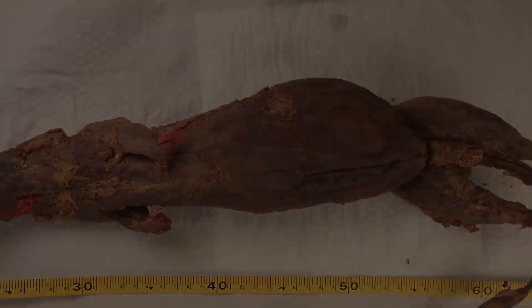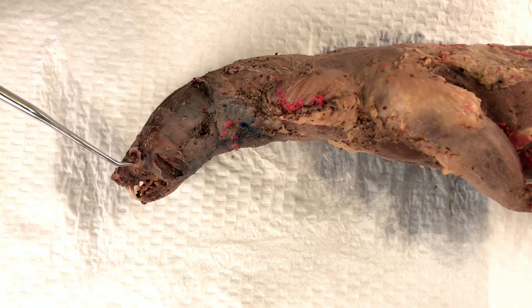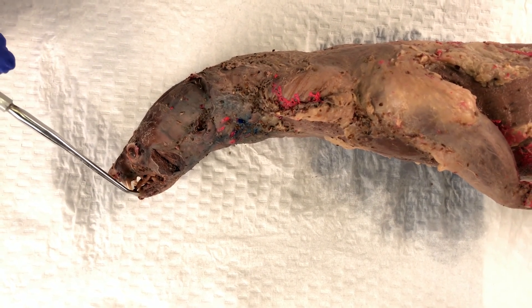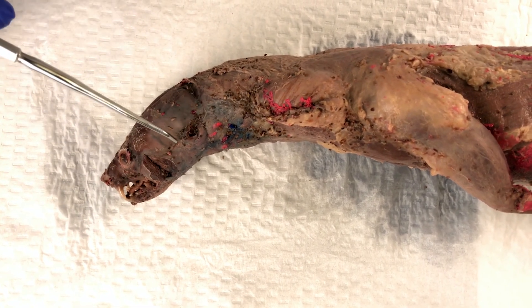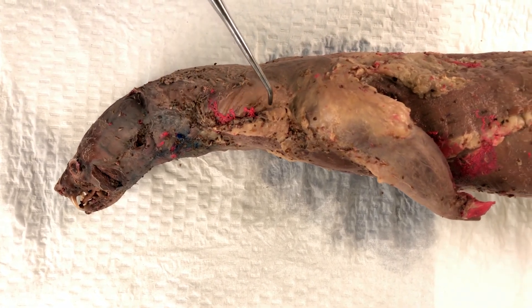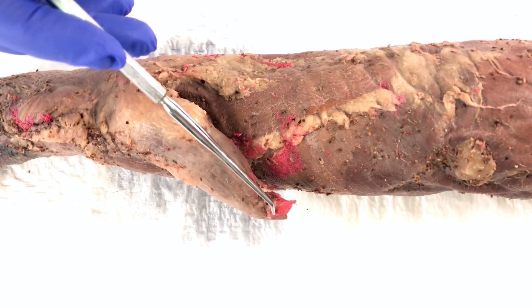Let's start with external features. Here we have the nose and the eye of the specimen. Because they are skinned, you can more readily see the tongue and the teeth of the specimen. Here is the ear. Moving back, we first encounter the front leg of the specimen. You can see where its front paw would have been.